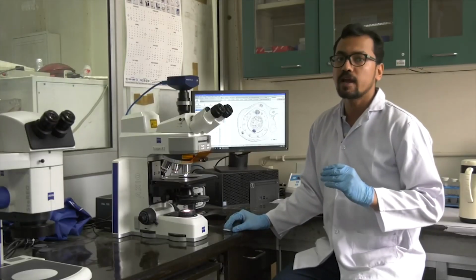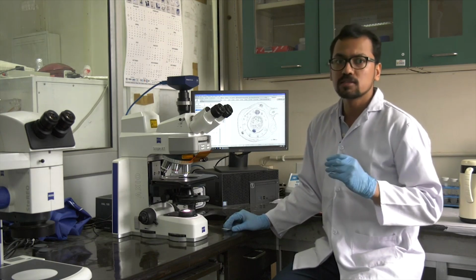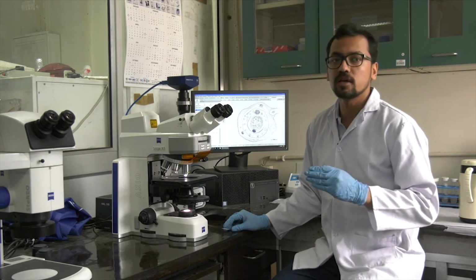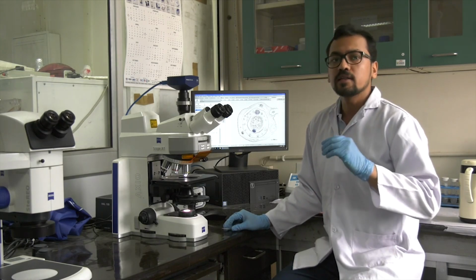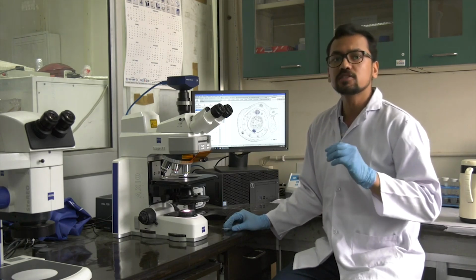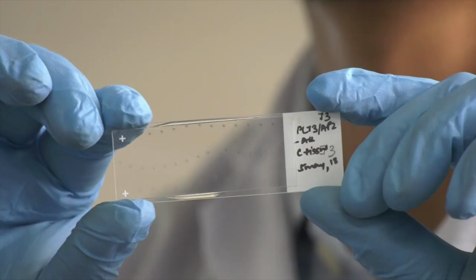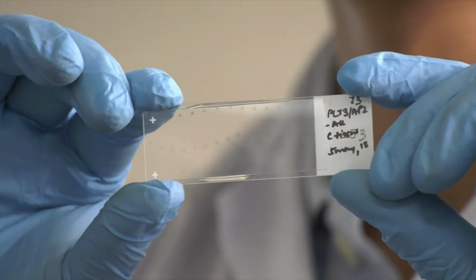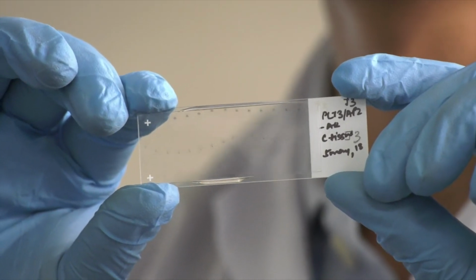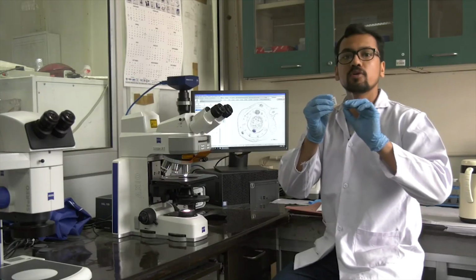So once the slide is dried overnight, as I have shown you, the slides are now dewaxed using xylene and then go through a series of steps as you have seen in the lecture, and then at the end, once the slide is probed and the signal is detected, it is fixed using Entellan and a cover slip is placed on it. So the slides look like this. You can notice that there are some blue spots over here, which is basically the signal. This is a color reaction, so a color has developed and it is seen in particular tissue only.